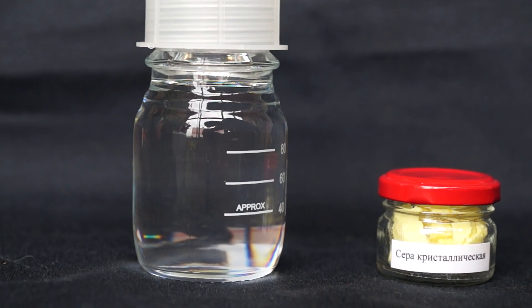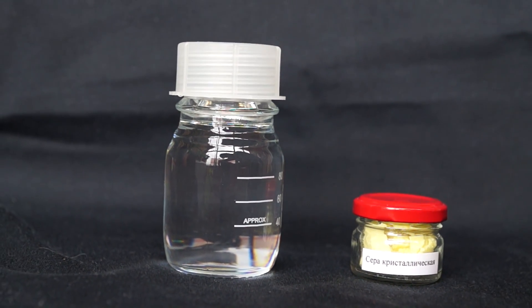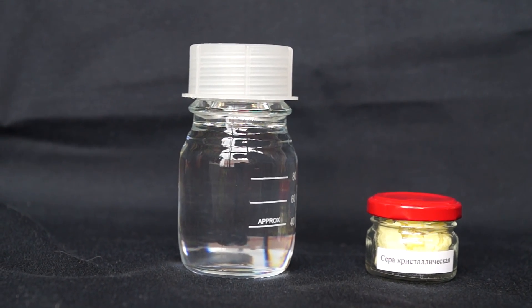Hello everyone! Today we are going to grow beautiful crystals of sulfur. For this we will need toluene and crystalline sulfur.